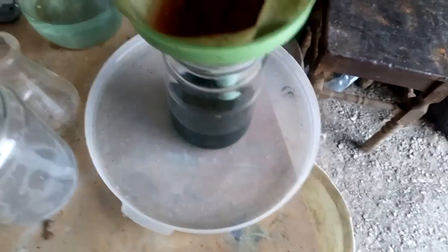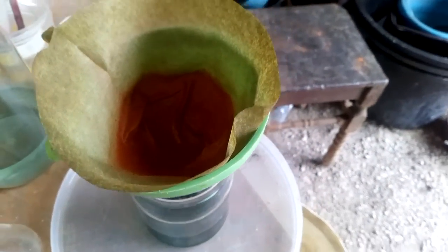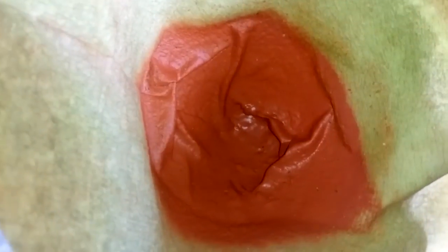Filtration is over. And here is our palladium — red brick palladium. It looks like a lot, but when you burn it, actually the size becomes very, very small. I will burn that with the acetylene-oxygen torch. We'll see how much palladium we got, and from the previous step, how much silver we got from those old-school MLCCs.